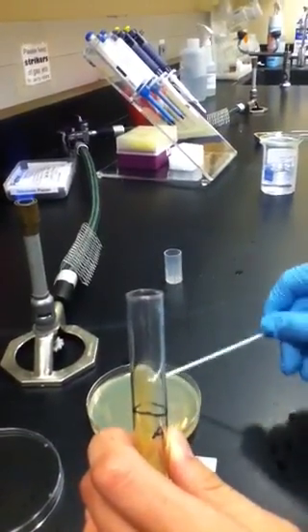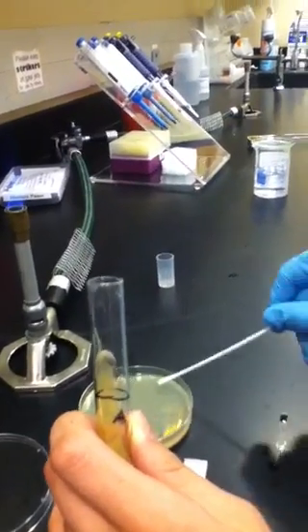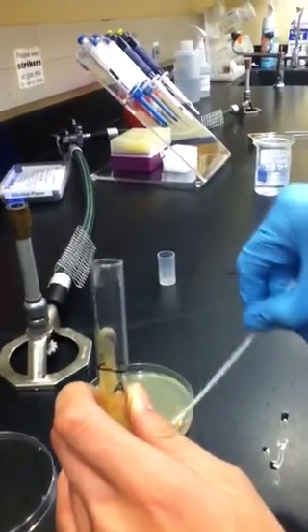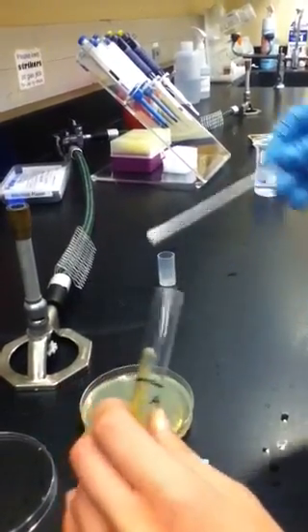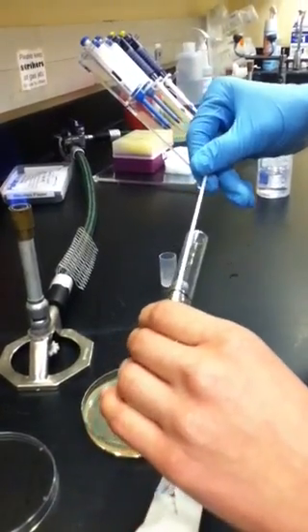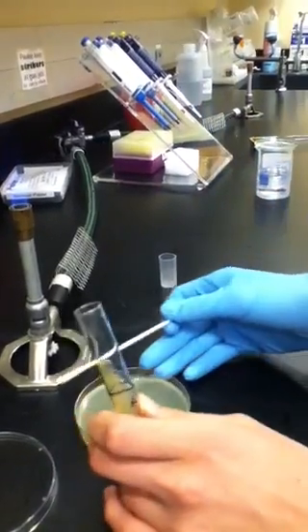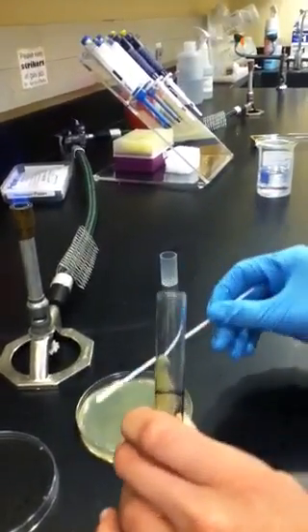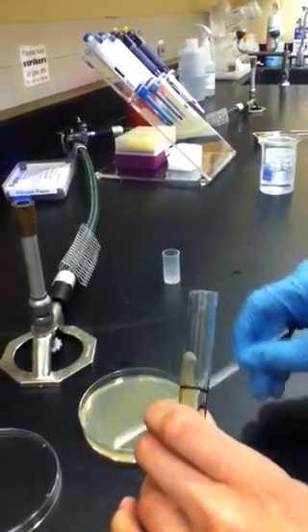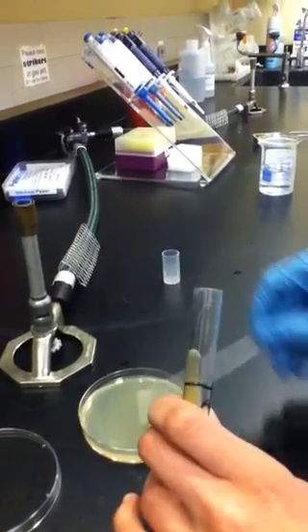They're probably not going to miss a spot by now — still missed a spot. Now I'm going to be really thorough: get some more bacteria and do it a little more at 45 degrees. This is actually very literally a complete lawn of bacteria.